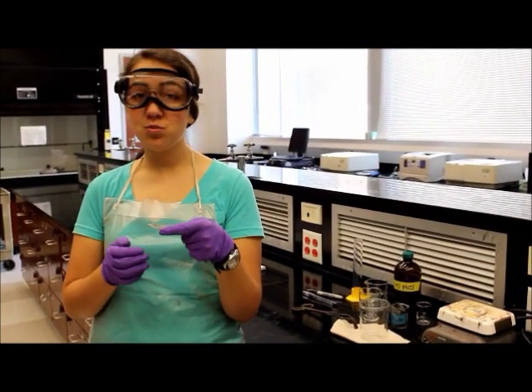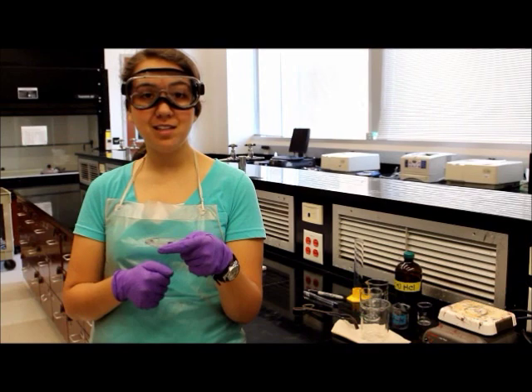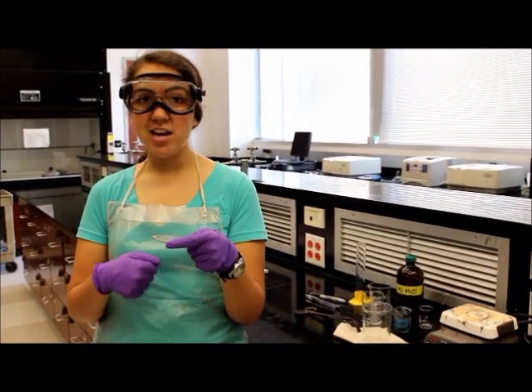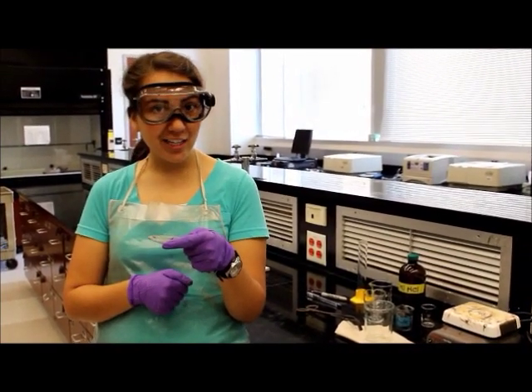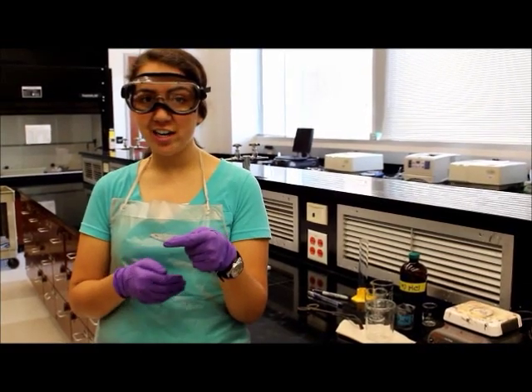Take your time, it's really important that it dries completely otherwise you will have skewed results and your precipitate yield will not be as accurate and you will not get your correct empirical formula.